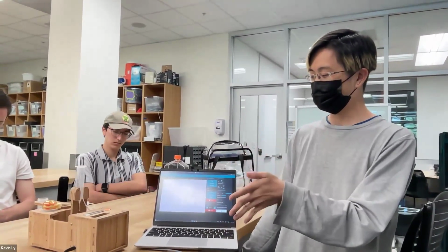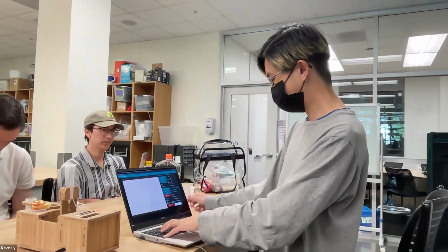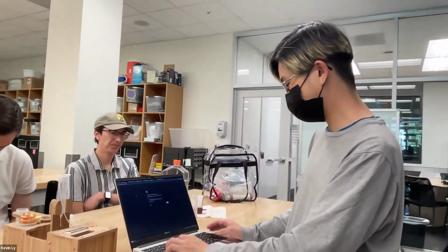Excuse me, can I ask a question? Is there actually a machine learning model to identify the plankton? Right. So I think right now the PlanktoScope software itself basically ends its work at extracting objects, and then you can do whatever you want with those extracted objects. Right now, the most common use case is that people will upload these extracted objects to a website called EcoTaxa. This is a project from a French marine lab.